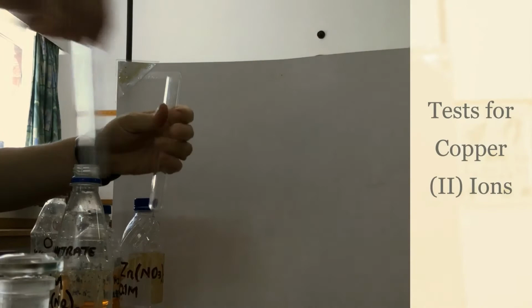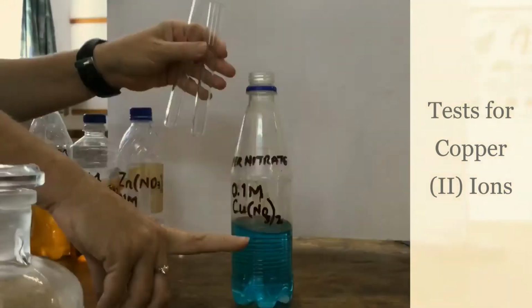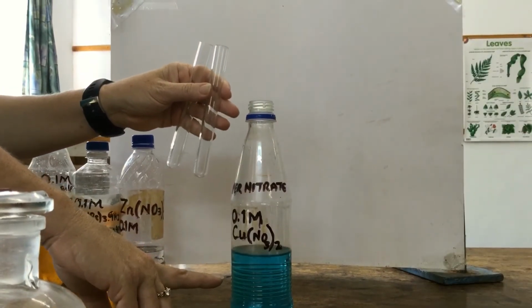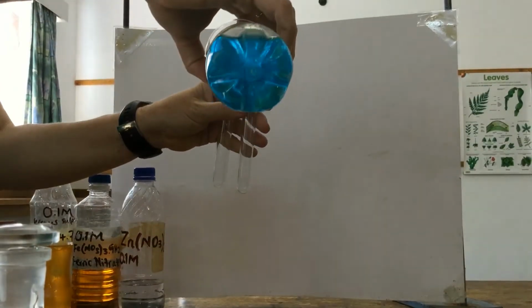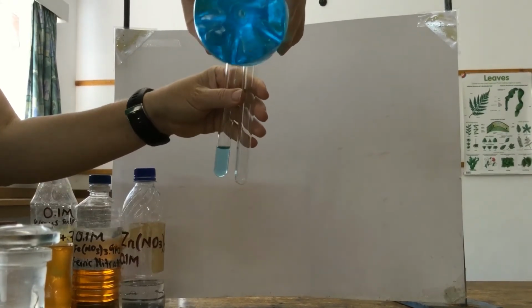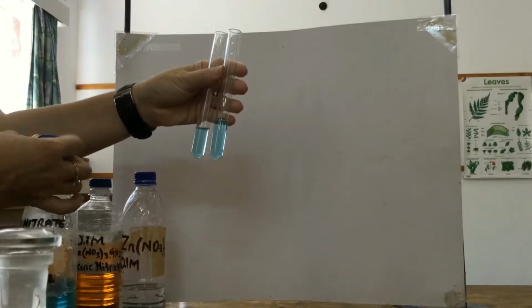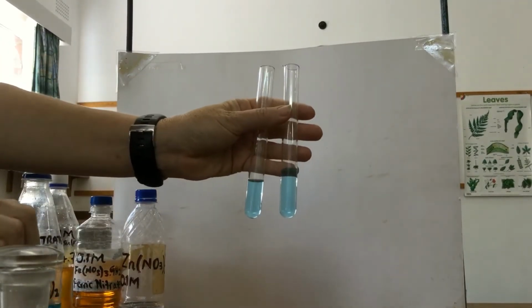Okay, next we're going to do the tests for copper ions. We've got copper nitrate. Copper, as I said before, is a transition metal, and transition metals often form colored compounds. So a nice bright blue copper nitrate. I'm going to add 3 cubic centimeters to 2 test tubes. I'm going to test first with sodium hydroxide and then with ammonium hydroxide.